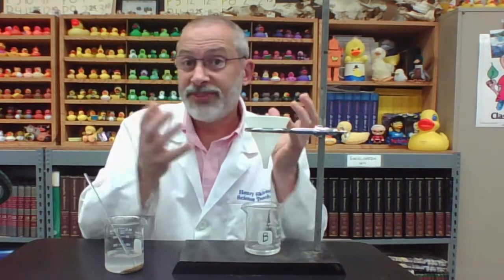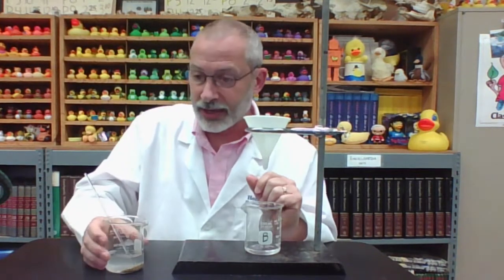But I want you to think right now before we move on. Think about what it is we have separated, if anything, as of now, using physical means of the decanting and the filtering. What, if anything, have we separated from beaker A to beaker B? What, if anything, have we separated using the filter paper and the decanting and the filtering? Think about that as I rearrange the apparatus and get ready for the next step.